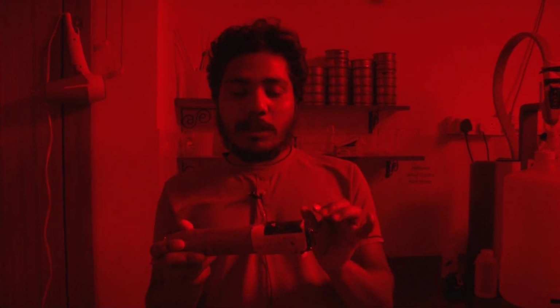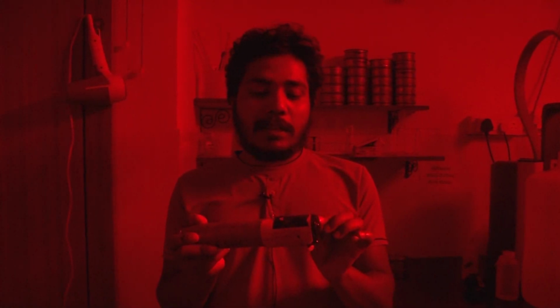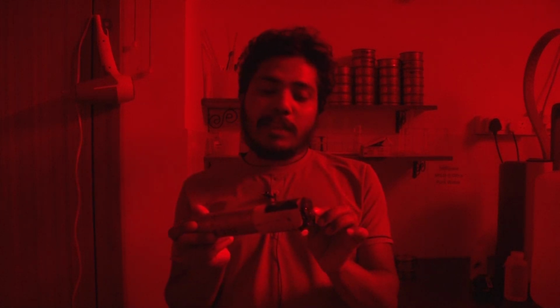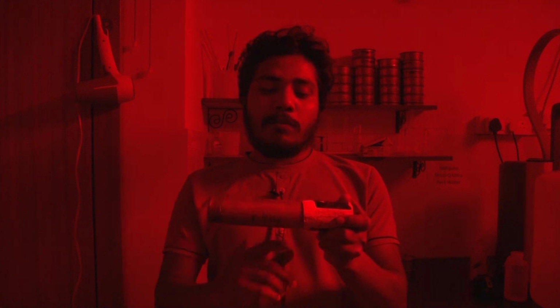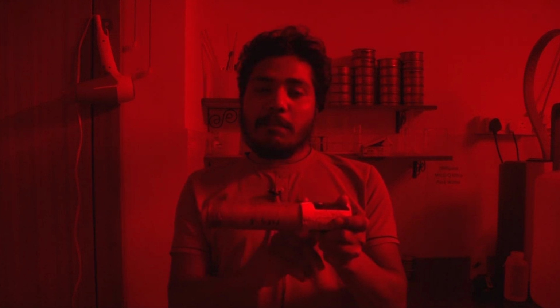Why are we discarding the 3 cm? Because it is expected that some portion of the sample in your pipe has some sunlight exposure. Sunlight can penetrate up to 3 cm. That's why we discard this 3 cm of sample from both sides, and you take the sample from the middle section of your pipe. That sample we can use for our laboratory procedures. The discarded sample you can use in the dose rate estimation and moisture calculation.